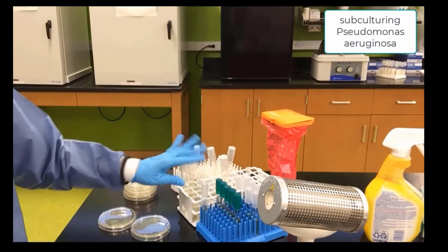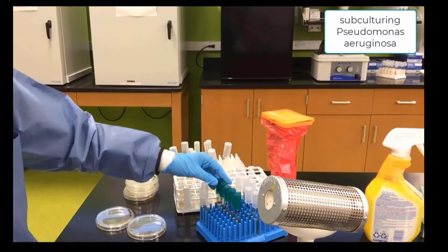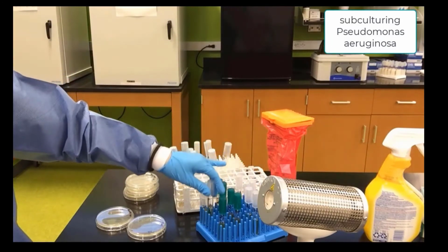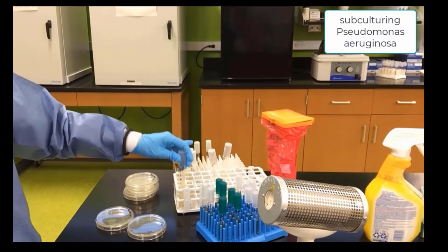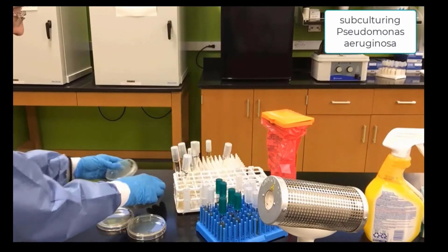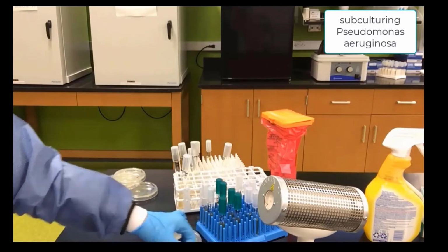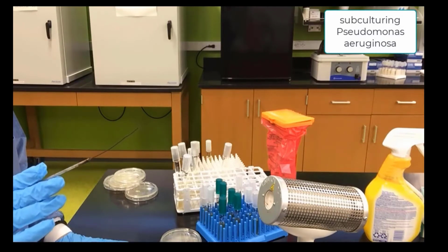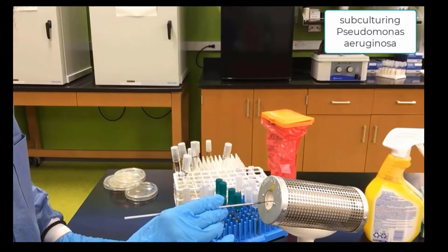We place our Pseudomonas nicely organized on a rack, and then we want to make sure we have everything organized and ready to go before we start subculturing. We want a nutrient gelatin, a liquid, the Agar Slant that is labeled Pseudomonas, and we also want to pull out the plate that we've labeled Pseudomonas. Getting a good system down after labeling is very important in order to go through the lab. Here's our loop. We will be burning the loop, sterilizing it, in the bacti-cinerator. This is called the aseptic technique, which means that it will not allow for contamination.